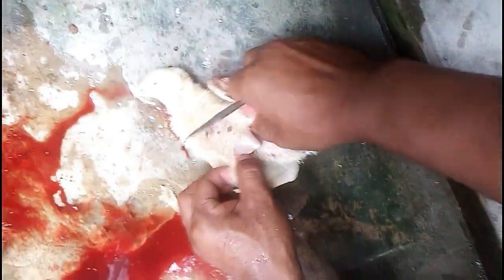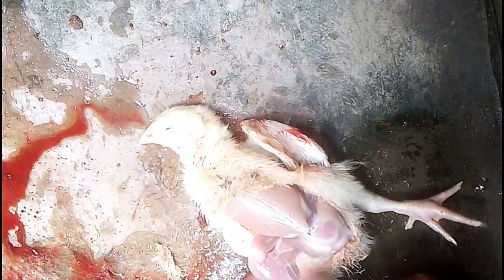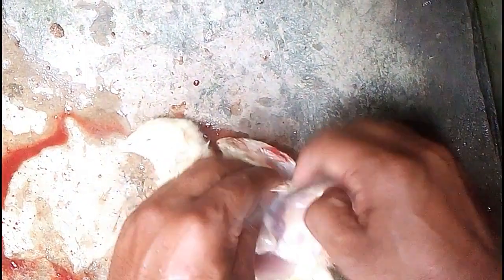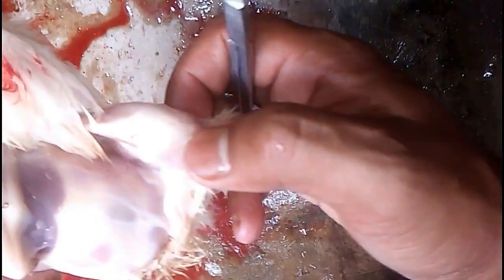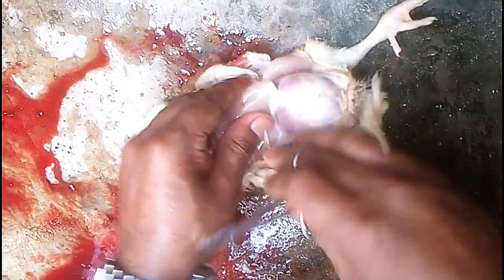First, we cut the skin of the stomach and try to open the breast muscle and thigh muscle. This is the thigh muscle, and here we want to find out the pinpoint hemorrhage over the thigh muscle, but it is fresh. Here we found one pinpoint hemorrhage. Next, we open the visceral organs.